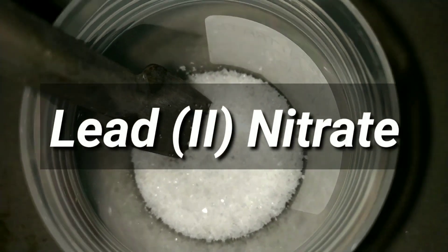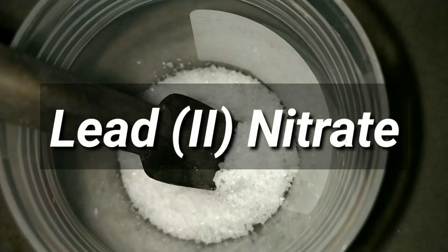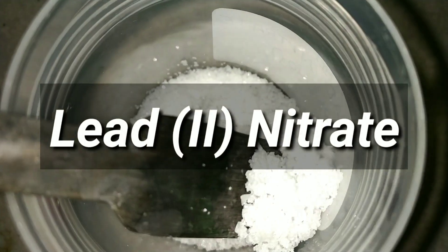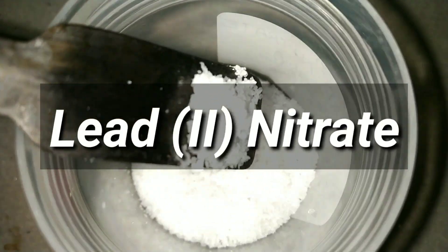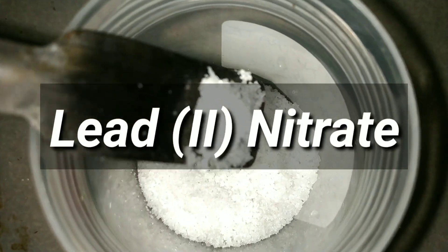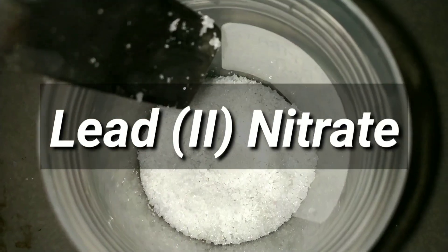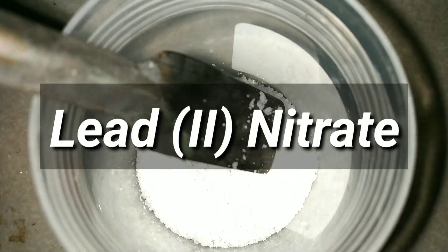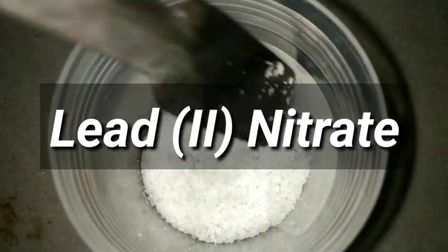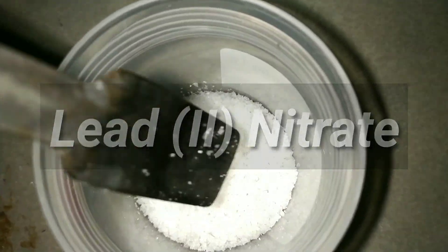Hello friends. In this video we will be synthesizing some lead nitrate, one of the most readily available salts of lead, and demonstrating its physical and chemical properties.